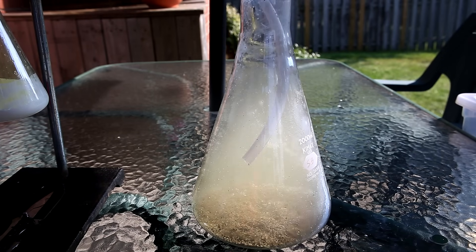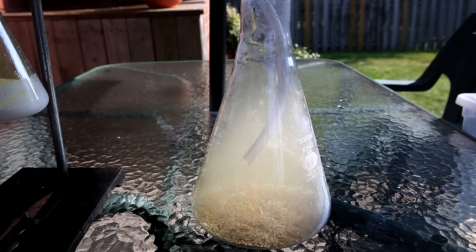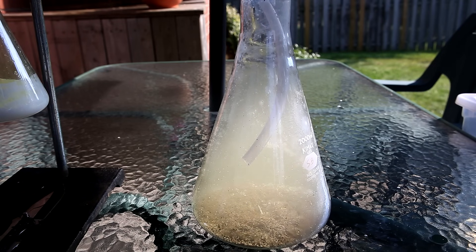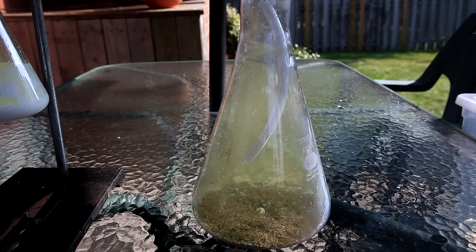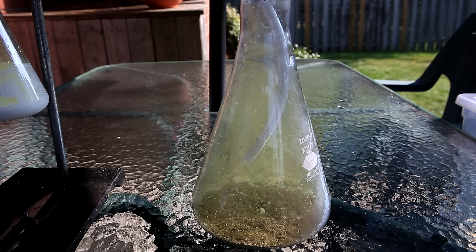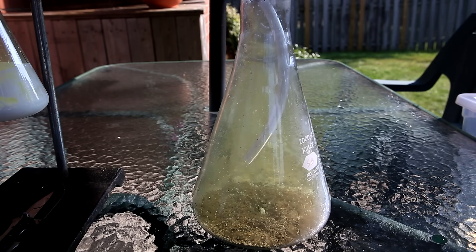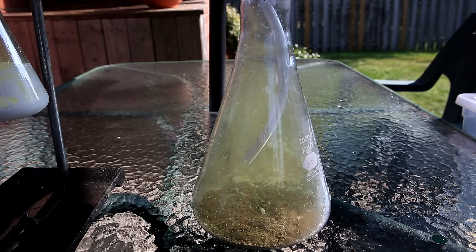I decided to try it again, but this time putting much less water to see what would happen. It took a bit longer to get started and there was more flame, but it wasn't too impressive. It was pretty short-lived and it wasn't very spectacular. Maybe it would be better if I used more sodium.